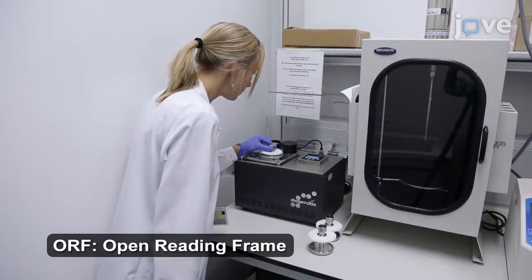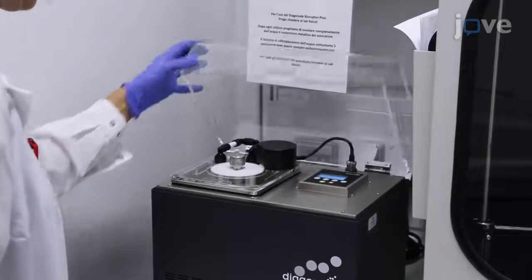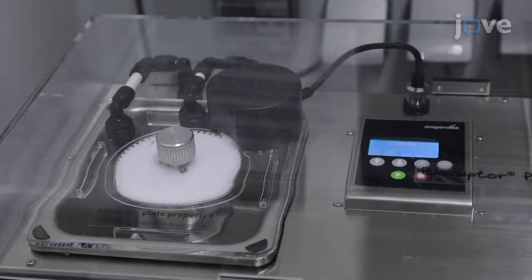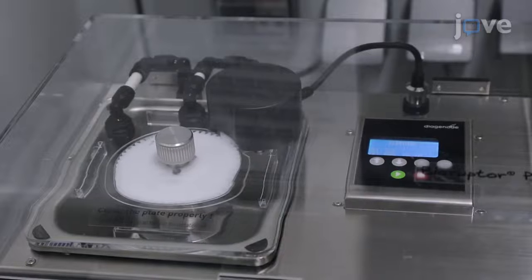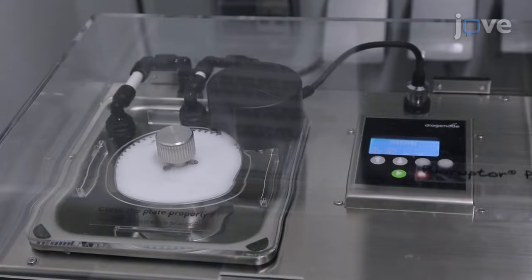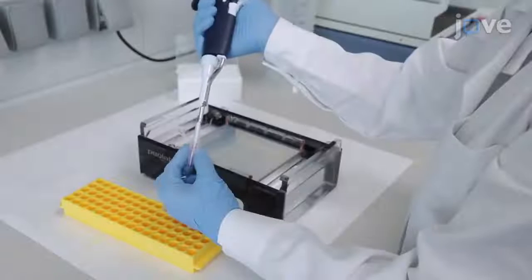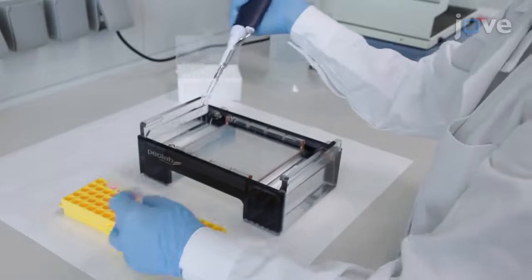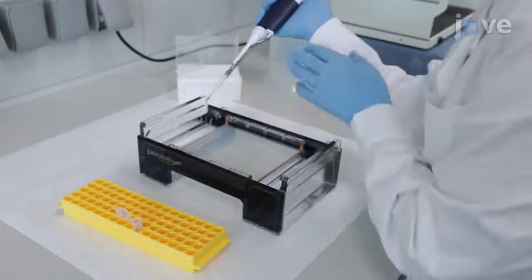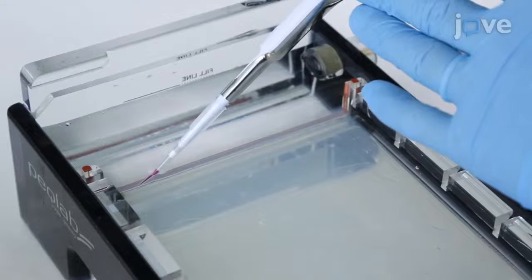To construct the ORF library, first sonicate the DNA with 30-second pulses at 100% output. After sonication, load the ladder and the sonicated DNA on a 1.5% agarose gel.